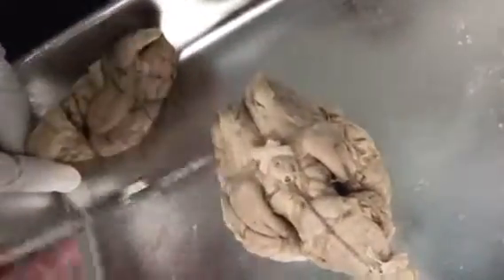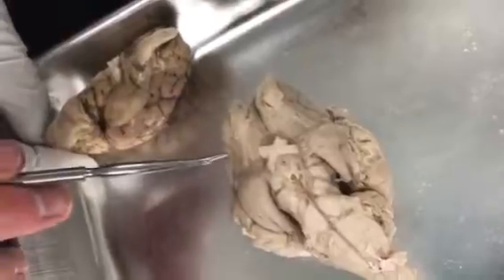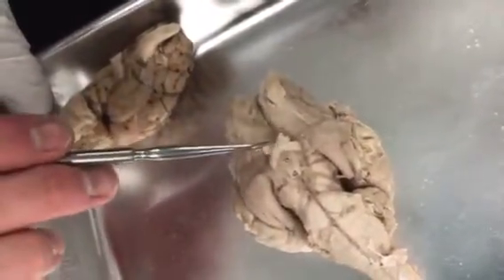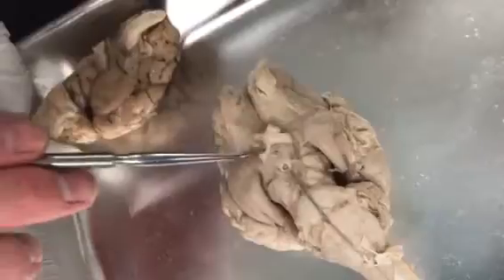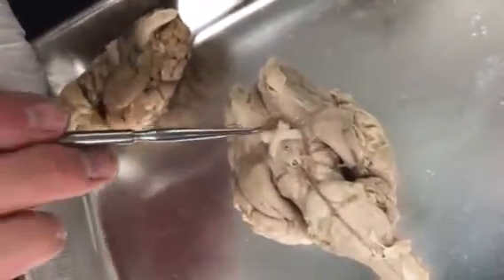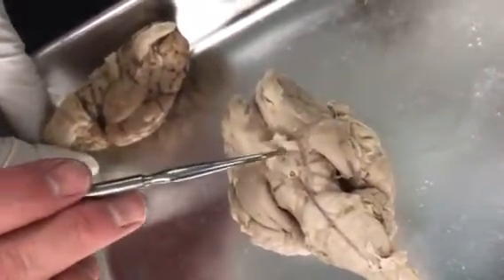Same thing with the optics. Eyeball over here. Picture it. Coming back from the eyeball, optic nerve. The optic nerves from the two sides come here and they cross. The optic nerve is coming here. After they cross, we call them the optic tracts. They're now in the central nervous system. Nerves were peripheral. Where they cross is called the optic chiasm.